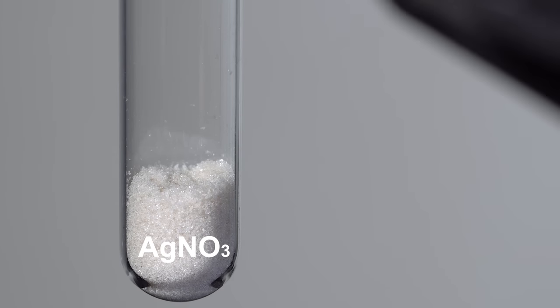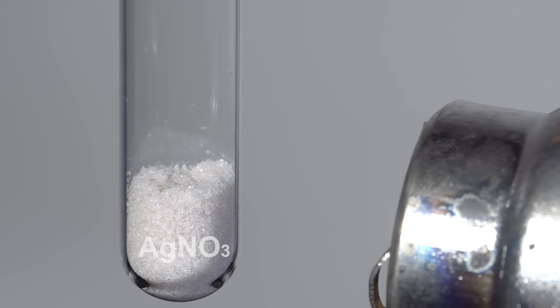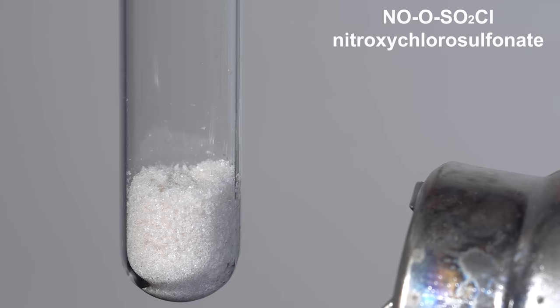Chlorosulfuric acid reacts violently with silver nitrate, giving silver chloride and nitroxychlorosulfonate.